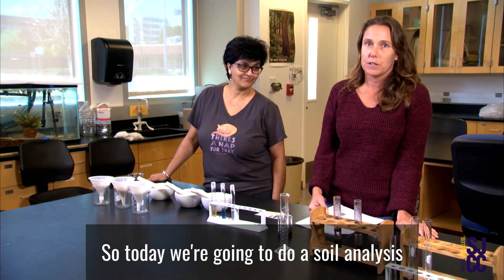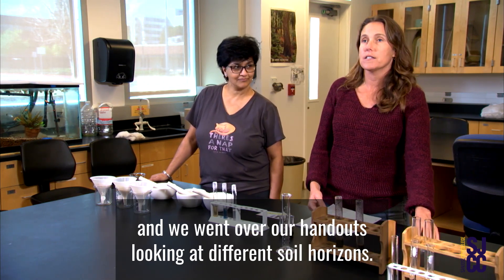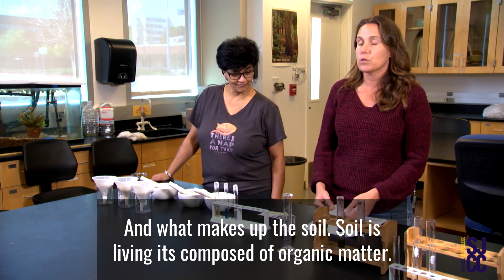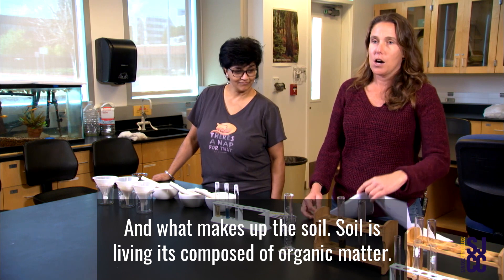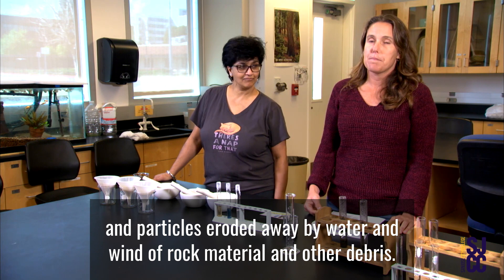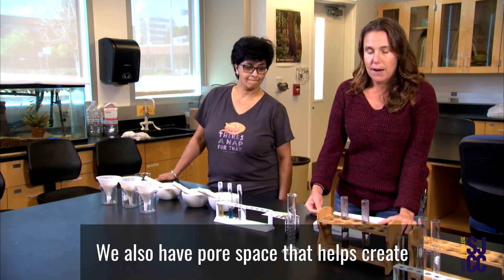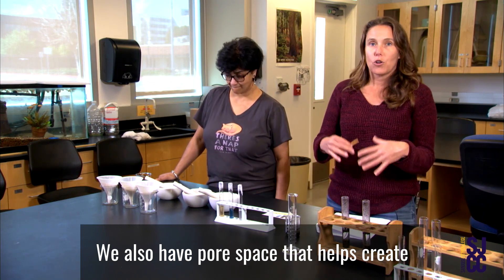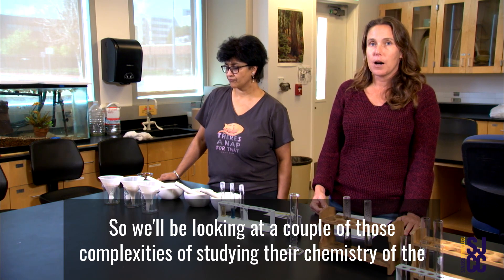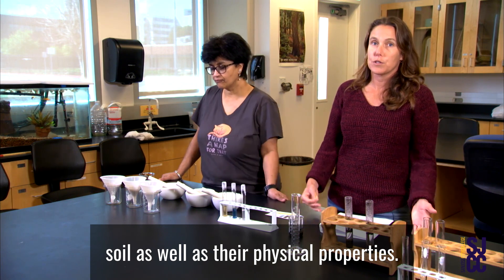Today we're going to do a soil analysis. We went over our handouts looking at different soil horizons and what makes up the soil. Soil is living — it's composed of organic matter, minerals, and particles eroded away by water and wind from rock material and other debris. We also have pore space that helps create airflow and water flow so that it can reach the roots. We'll be looking at the chemistry of the soil as well as its physical properties.